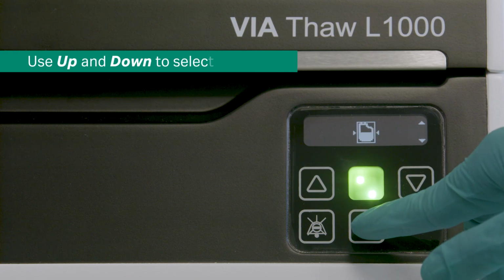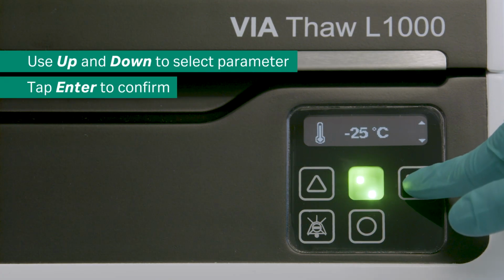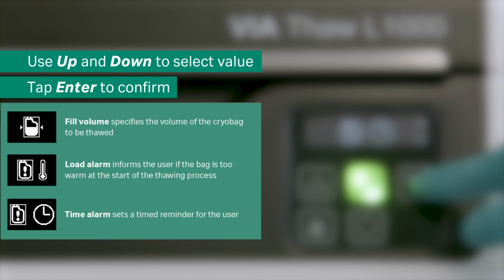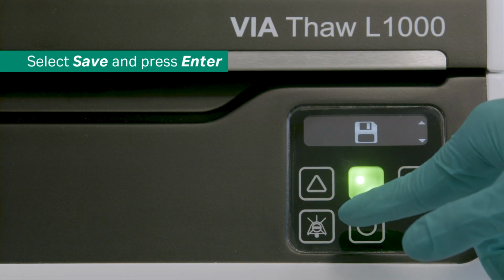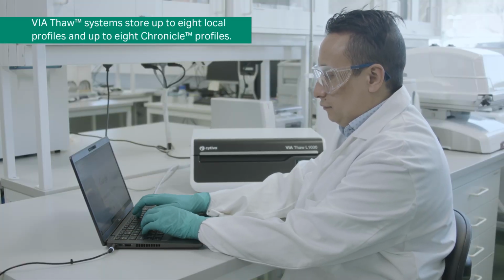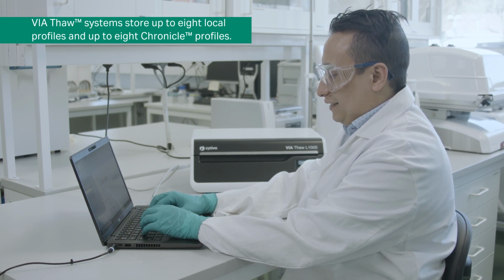Use the up and down buttons to select the parameter you want to modify and tap Enter to confirm. Use the up and down buttons to select the value you want to modify and tap Enter to confirm. To save, select the Save icon and press Enter. Profiles can also be created within Chronicle and downloaded to the instrument, adding or replacing pre-existing Chronicle profiles.